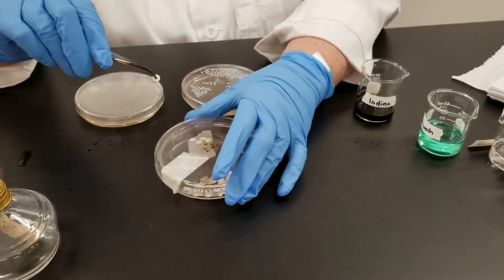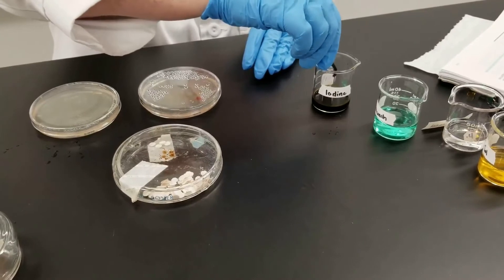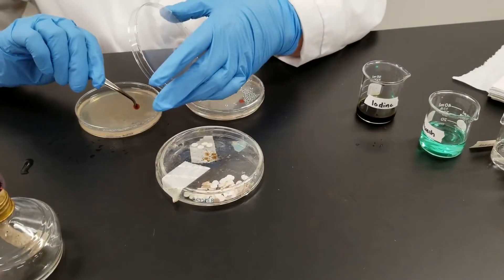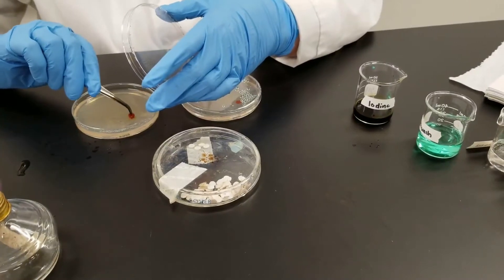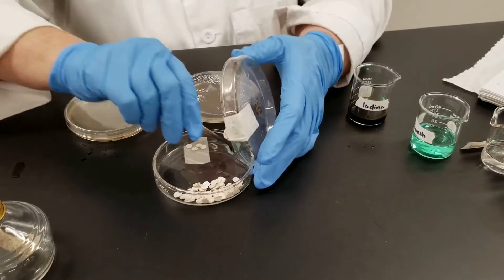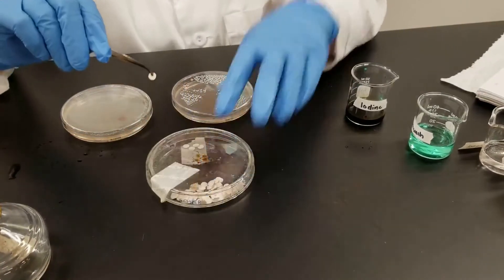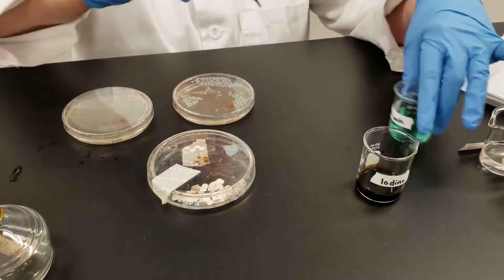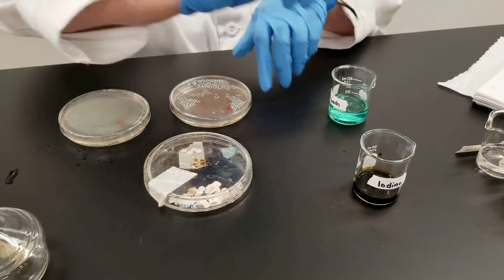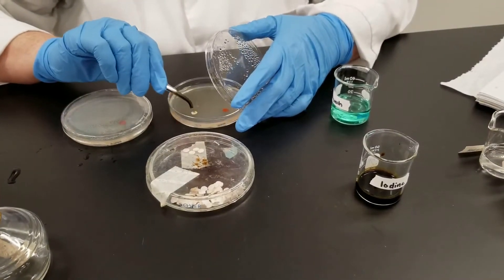The idea is that the chemicals can diffuse out into the medium, since it's already been inoculated. We will see if it has any effect — basically whether it will inhibit the growth of the bacteria or not. Then we will incubate the plates for 24 hours at 37 degrees C and see what effect it has.